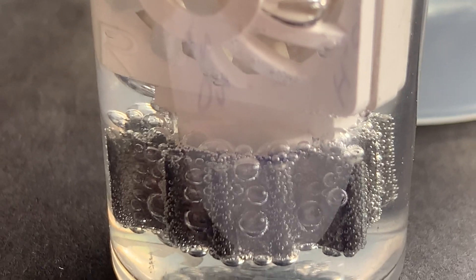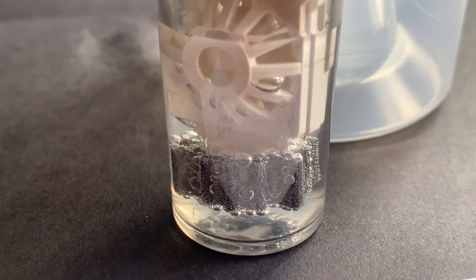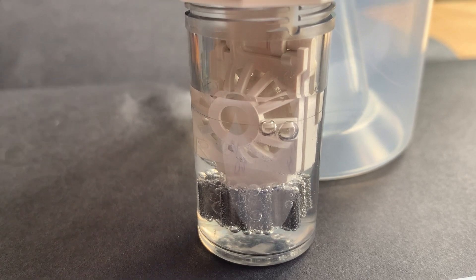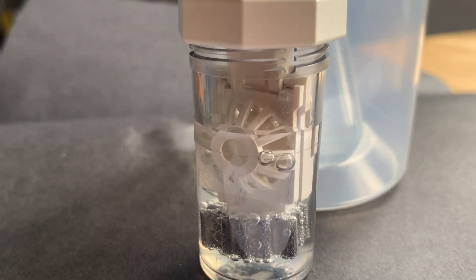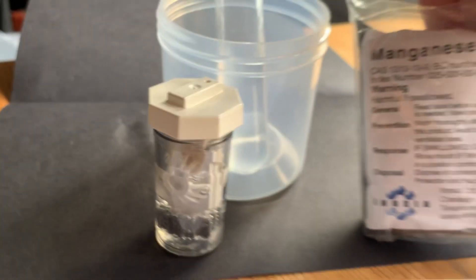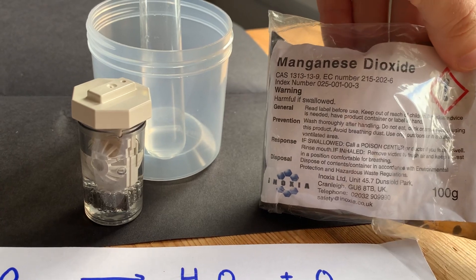I can let that continue. Do you wish there was another catalyst that made it work even faster? Well, there is. That catalyst is called manganese dioxide, MnO2.